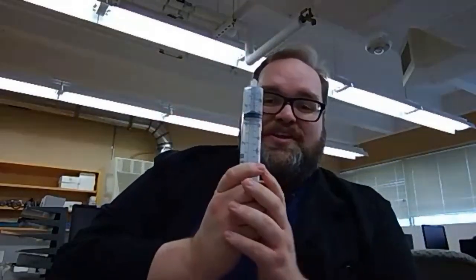To do this, we're going to need three pieces of equipment. One, we're going to need a piston system. So we're going to use this 60 ml syringe. In your textbook or in your lab book, it may say something about a 20 ml syringe. We're going to do a little extra today, and we're going to do a 60 ml syringe.